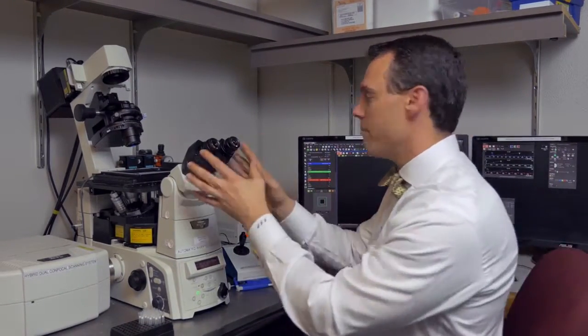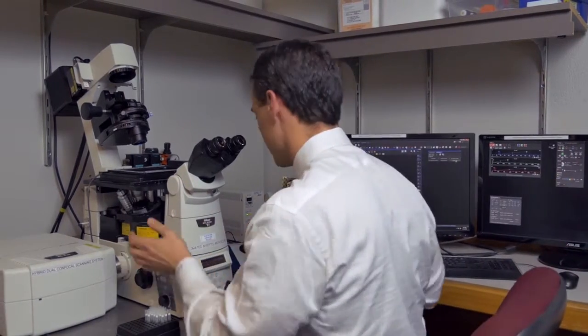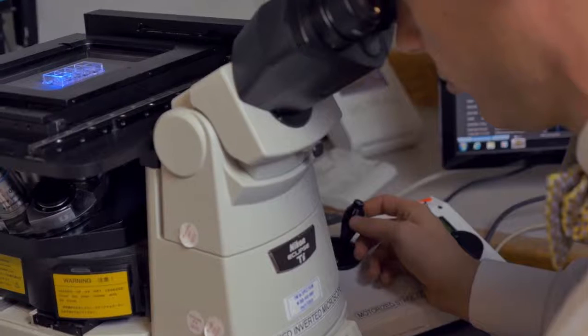And so what I'm going to do is I'm going to get a few cells into focus here. I will then bring that imagery over on to the computer screen here so that you are able to see what I am seeing, and then we'll add in the essential oil, and we will be able to see this essential oil entering in the cell. So I'm going to take a few moments here and I'll just get this imagery in focus.